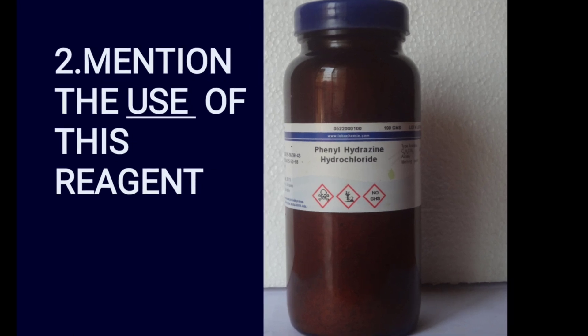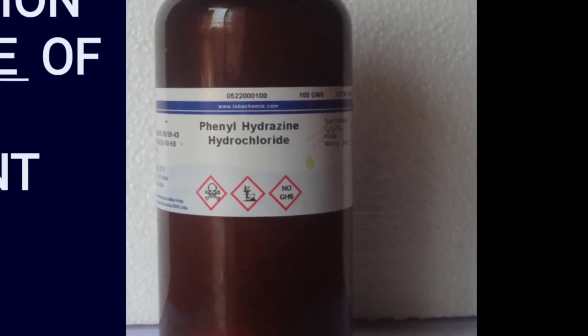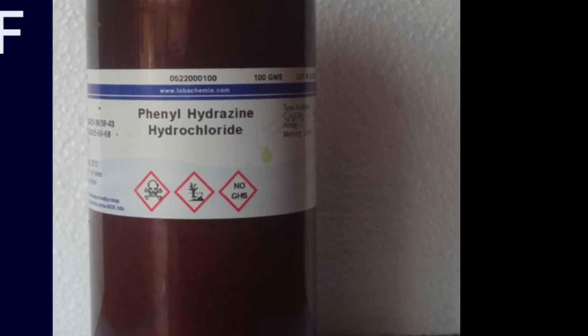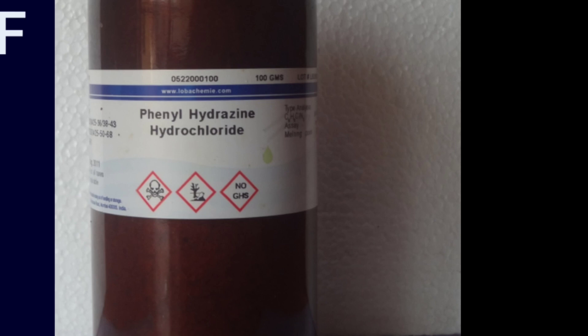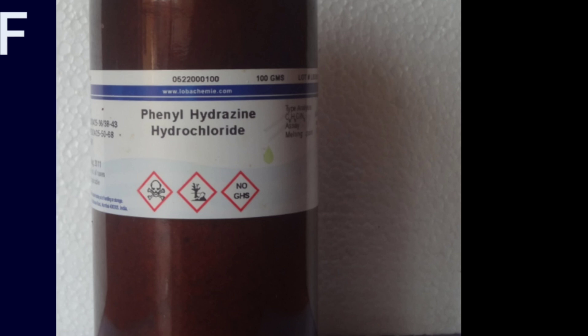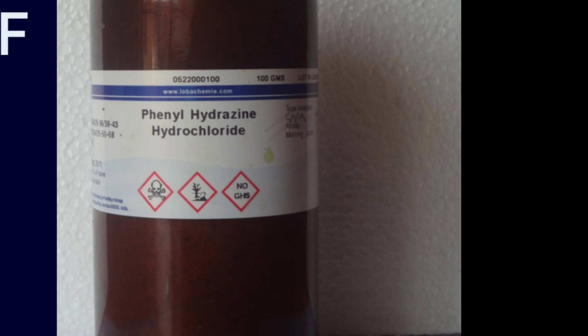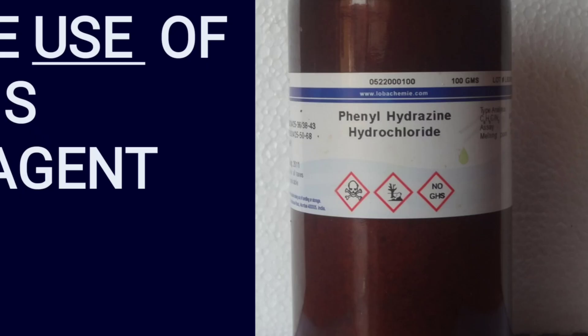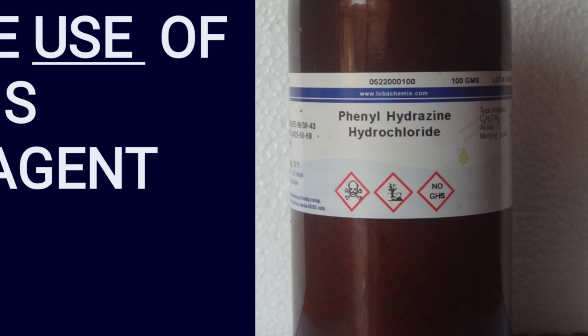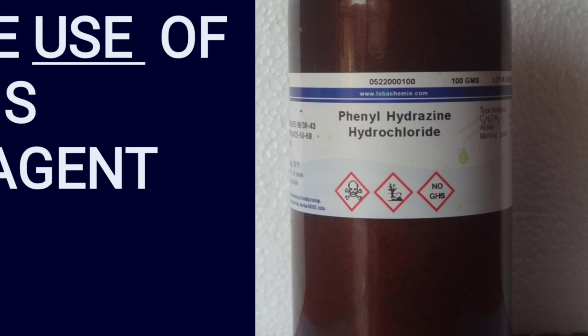Spotter two: mention the use of this reagent. This is phenyl hydrazine hydrochloride. It is also used to detect the presence of reducing sugars — by the osazone test.